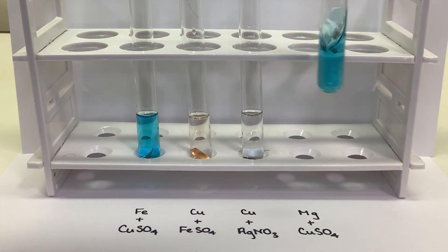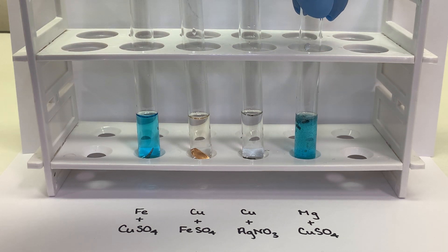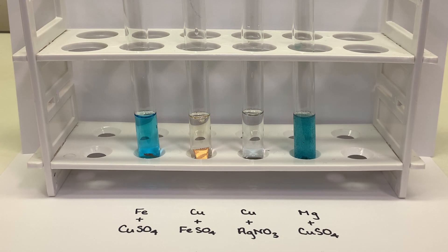Okay, now that all of our reactions are set up, we will be waiting 15 minutes before we make our first set of observations. I'm going to speed up the clock here so that we can get 15 minutes condensed into about one and a half minutes.